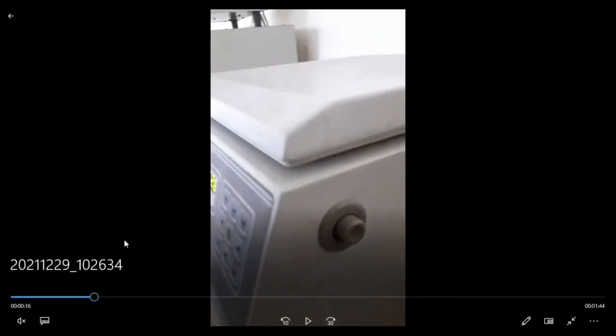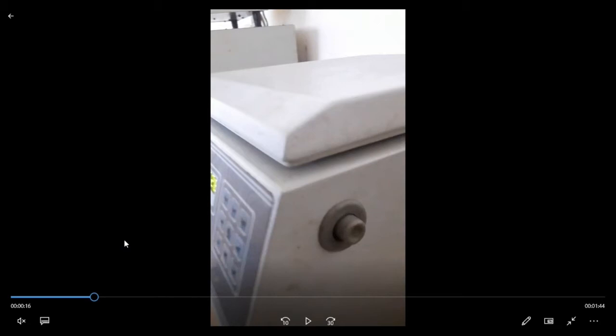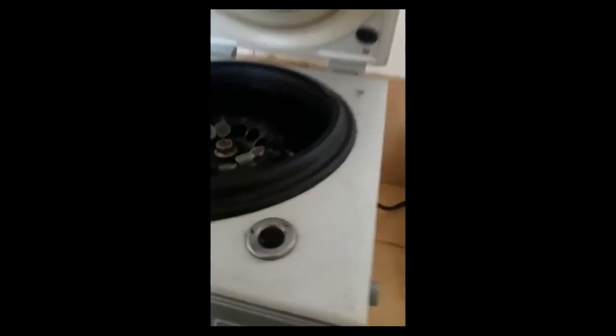This is the power button. When you plug in the centrifuge machine, you have to turn on this button. You can see that. And here is the opening button. You will press it and then this lid will open. Once you input your data and commands to the centrifuge machine and lock this lid, the centrifuge machine automatically locks. And after the rotations are completed, you have to push this button to open the lid. Like this, you will press the button and this lid will open.